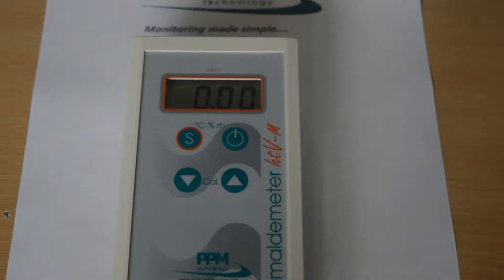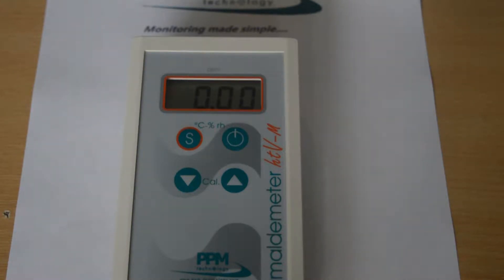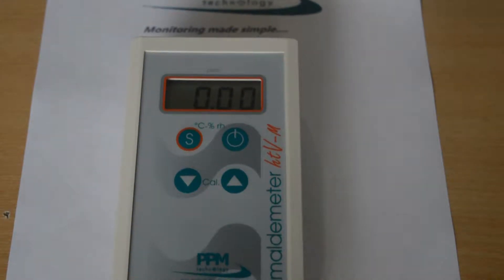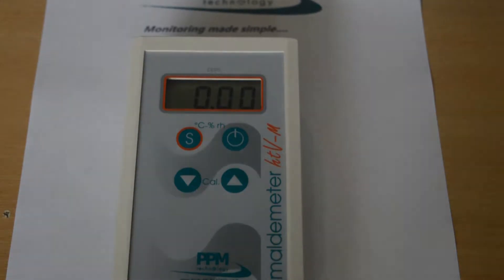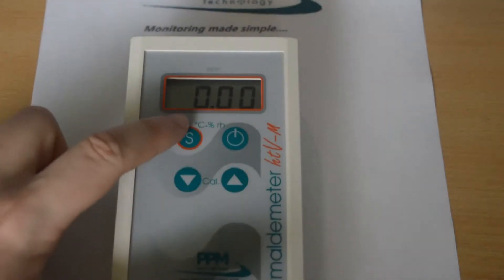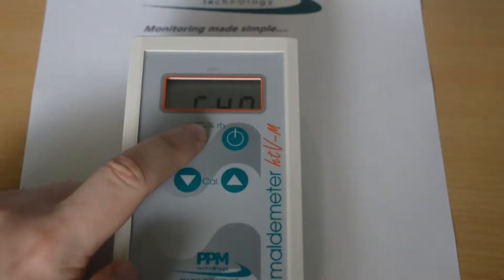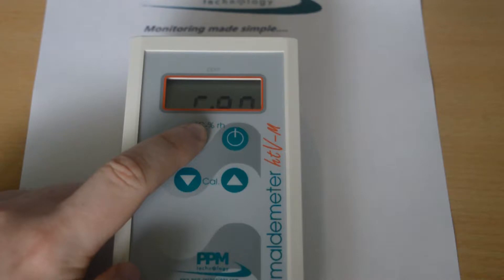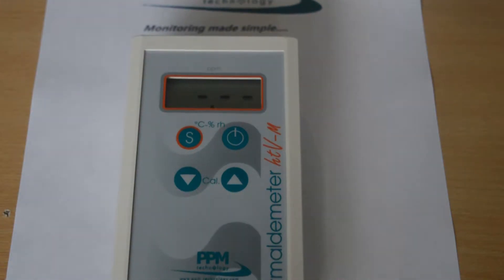To sample, simply press the S button. The display will change from 0.00 to 'run', at which point you should hear the internal pump running for around 2 seconds.